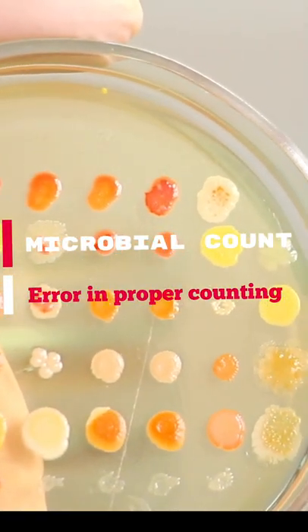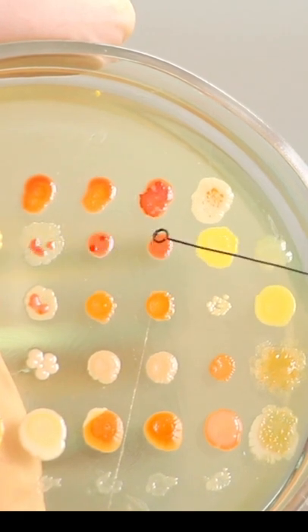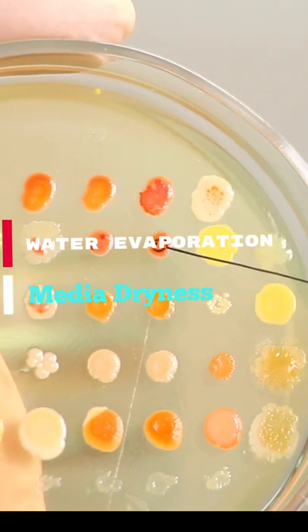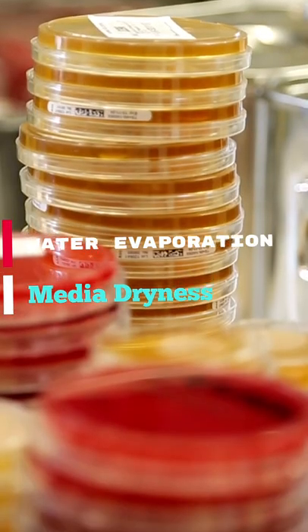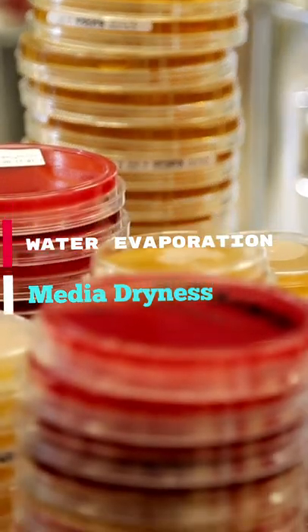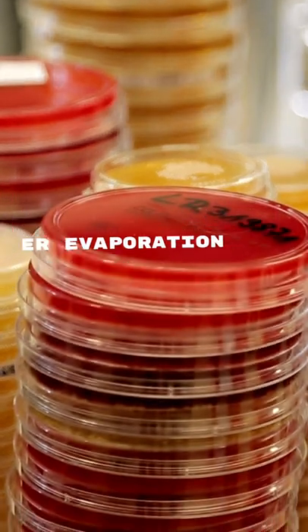The evaporation of water from media can cause media dryness that can affect microbial growth. But when the plates are incubated in an inverted position, the rate of evaporation decreases, resulting in proper microbial growth.